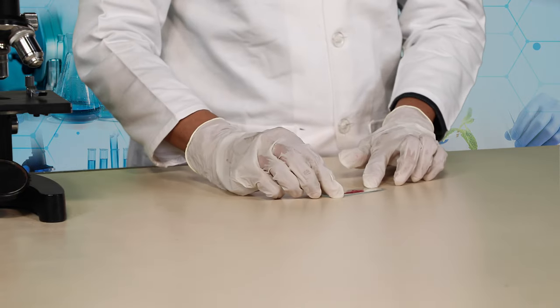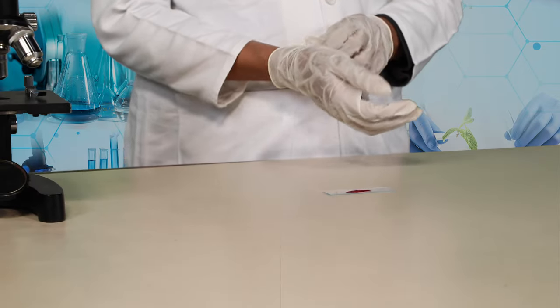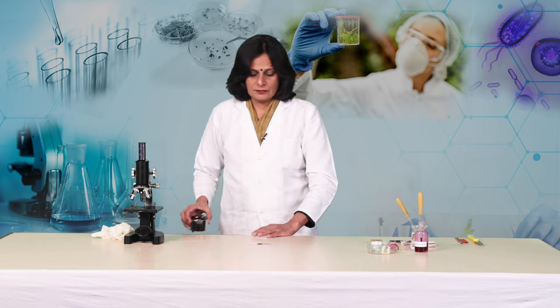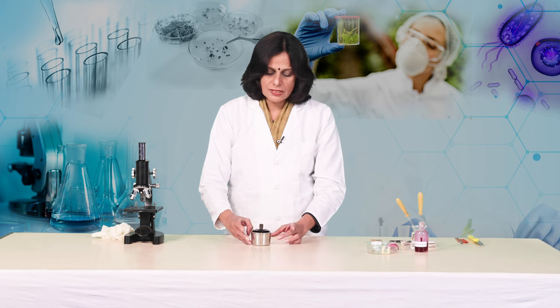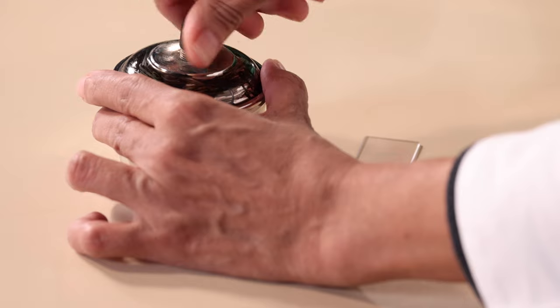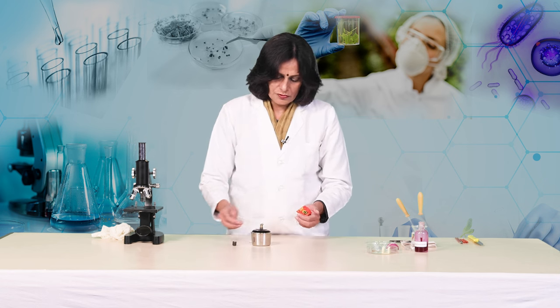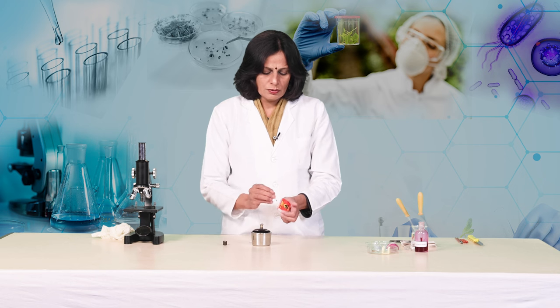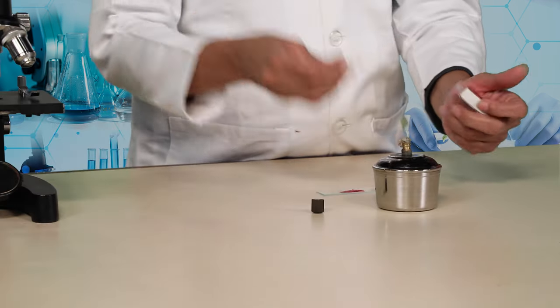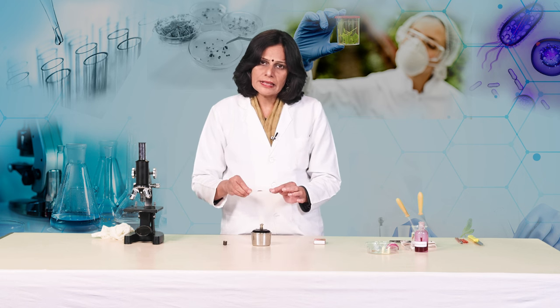We are going to heat this slide over the flame of a spirit lamp gently. This is the spirit lamp. We are going to heat this over the flame of the spirit lamp, but here the precaution is that overheating should be avoided.